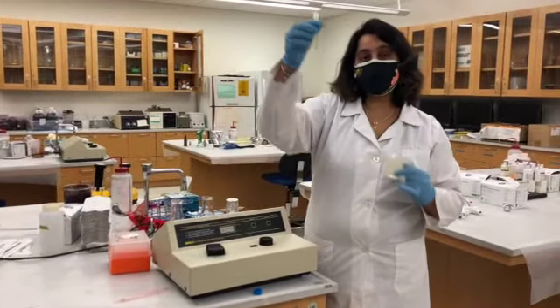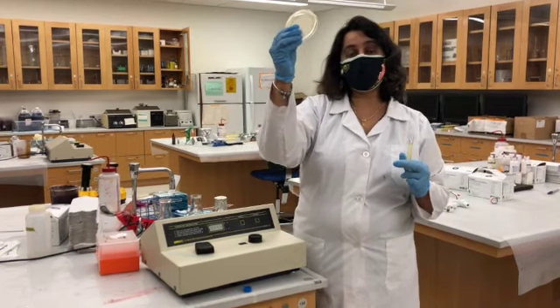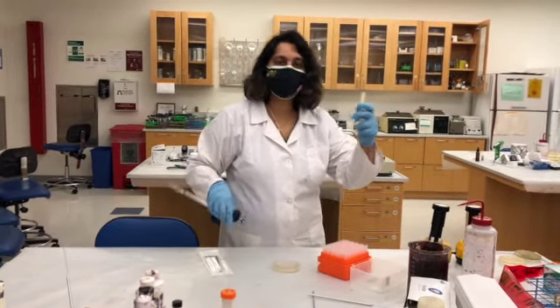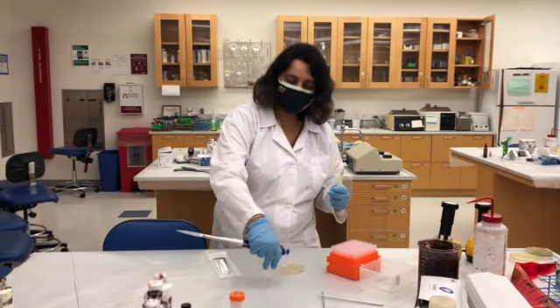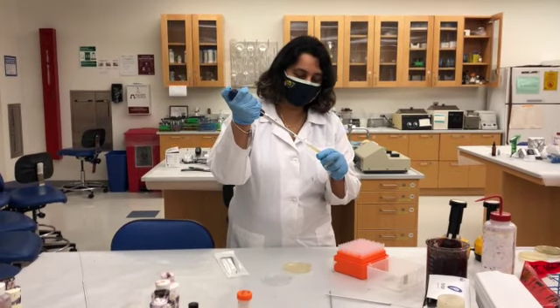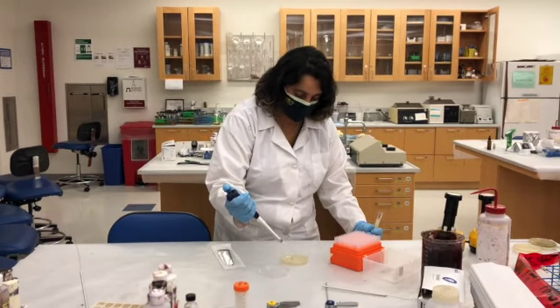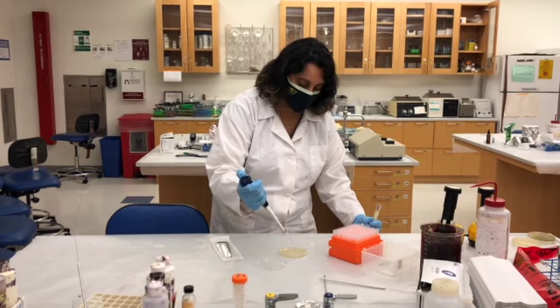So I have this actively growing bacterial sample, and I'm going to show you how to track the bacterial growth on the petri dish. So once you have the actively growing bacteria, just to make sure the cells are viable, we spread them on a TSA plate. So I'm taking some of the sample, approximately 100 to 200 microliters, and add on the petri dish that has the tryptic soy agar media.